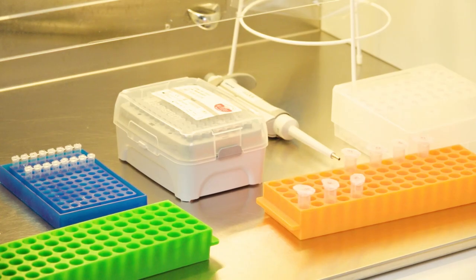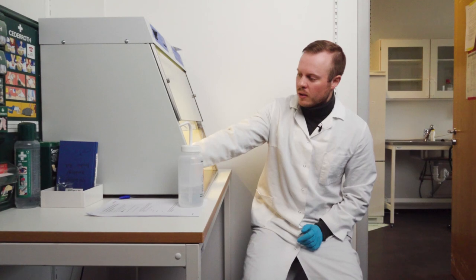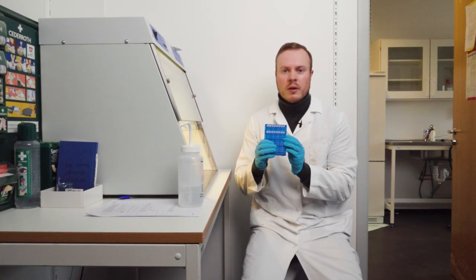And while it's running, we will also clean up the entire space so somebody else can come into the lab and have a nice working environment. So you have all the samples there and they are mixed.